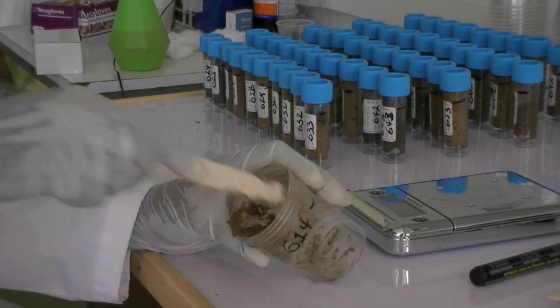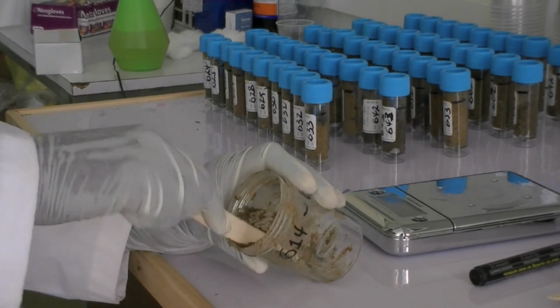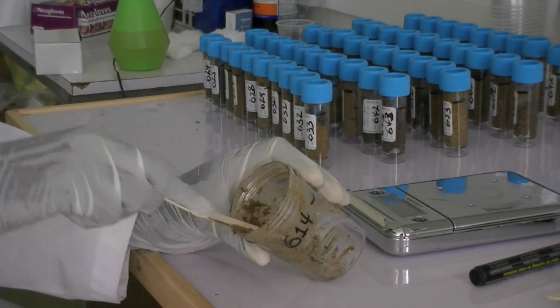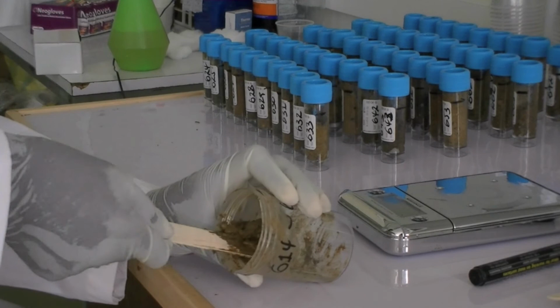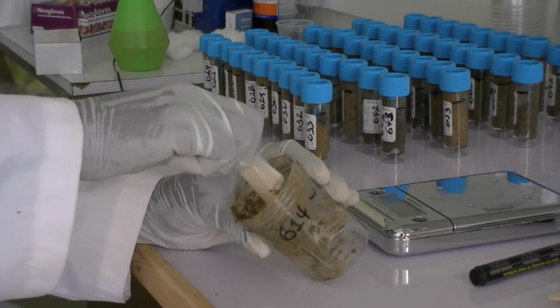It's not always clear when to decide a sample is entirely homogenized. However, stool samples can vary considerably in color, and hence, as a rule of thumb, it can be stated that a pool is thoroughly homogenized when it is equally colored.